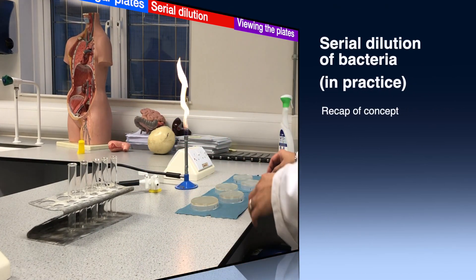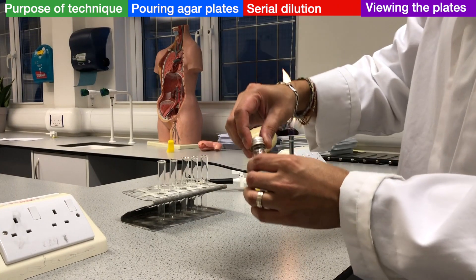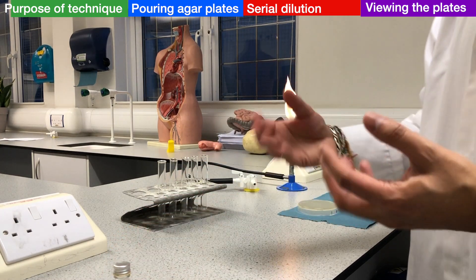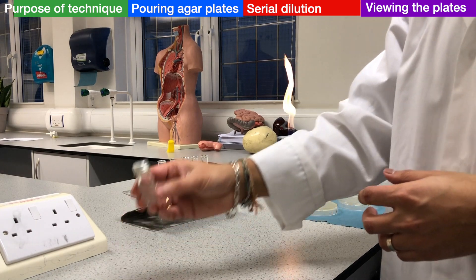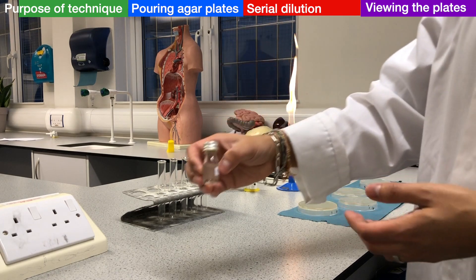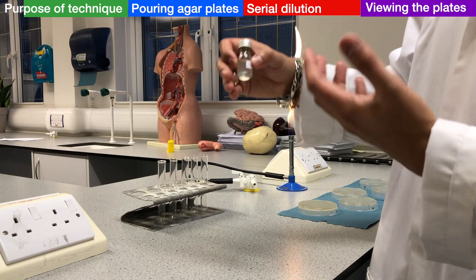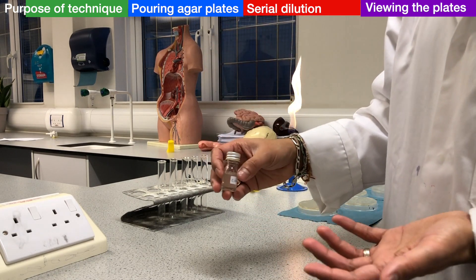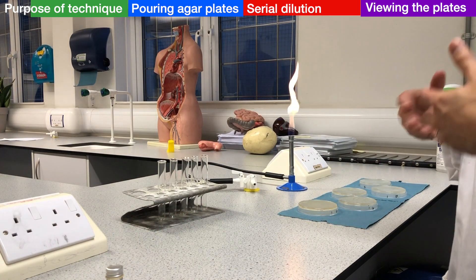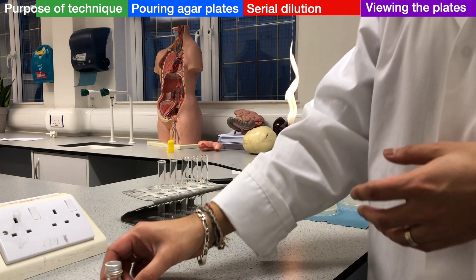So let's get started. The purpose and objective of this experiment is to be able to estimate the density of live bacteria in this bacterial culture. We don't know what the density is, and that might be part of a bigger experiment where we are measuring the effect of different factors on bacterial growth — perhaps different temperatures, pHs, nutrients, or levels of oxygen. Once we have cultured the bacteria in those different conditions for a certain amount of time, we want to measure the effect of that factor on the growth of the bacteria.